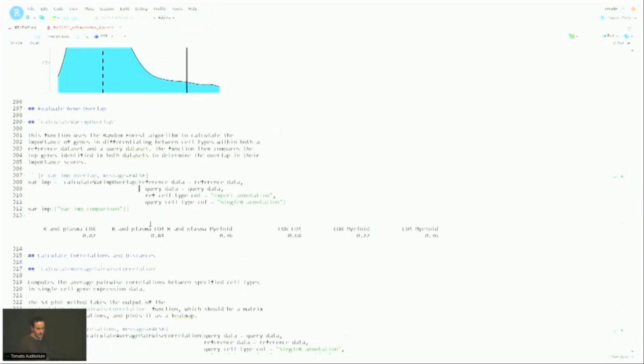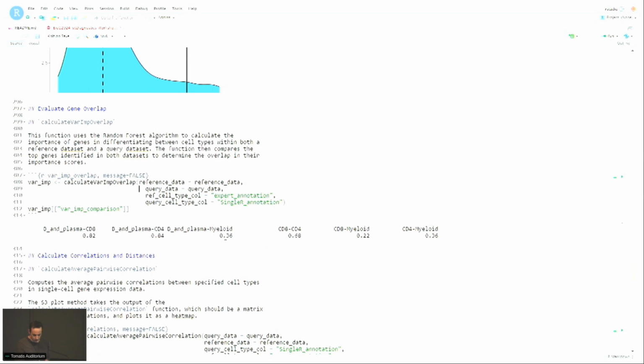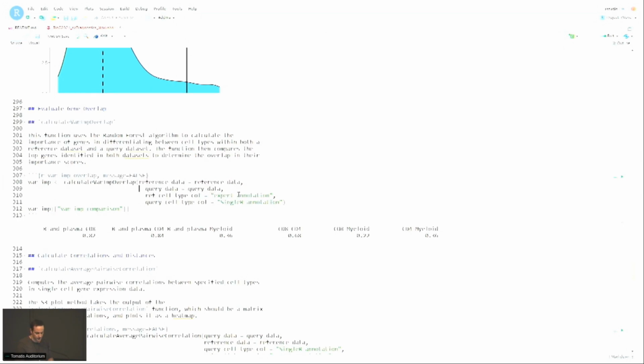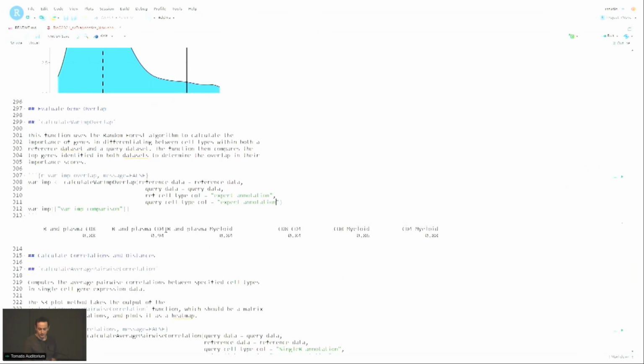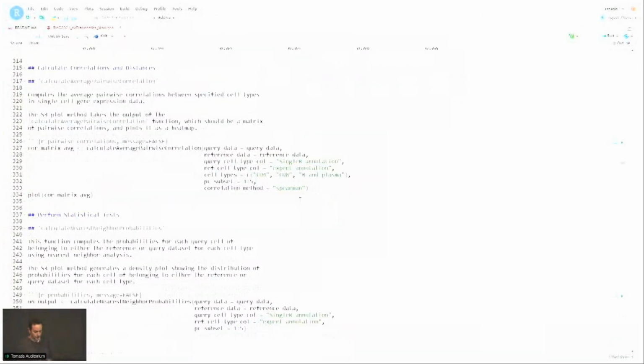So here we can see that this is the overlap between the sets of important genes for the reference and the set of important genes for the query to distinguish the two cell types. Obviously, it doesn't look too good for many of them, right? A lot of them are below 0.5. If I were to switch, for example, to expert annotation, right, you can see that now things look much better. So nothing falls below 0.8. Okay. All right.